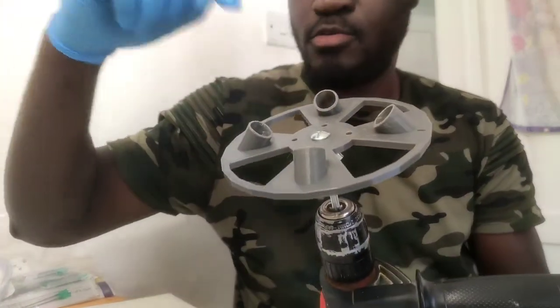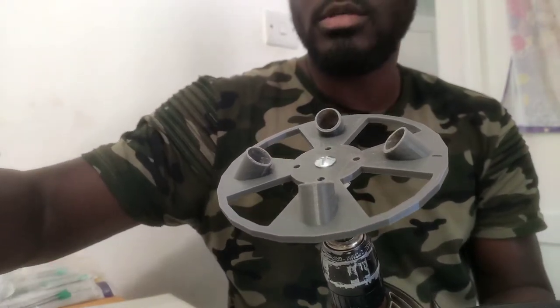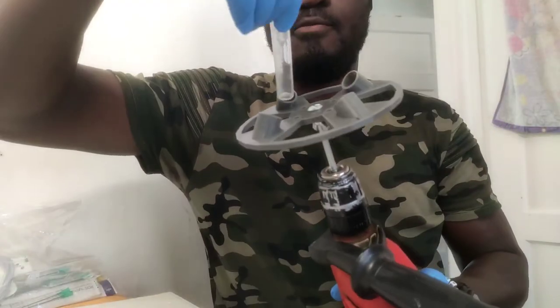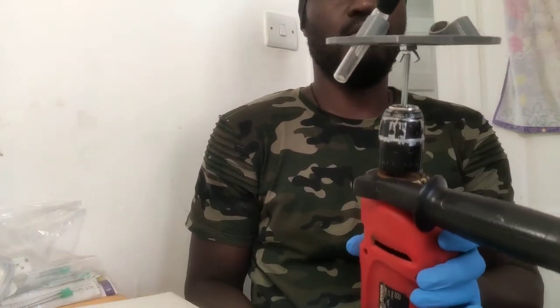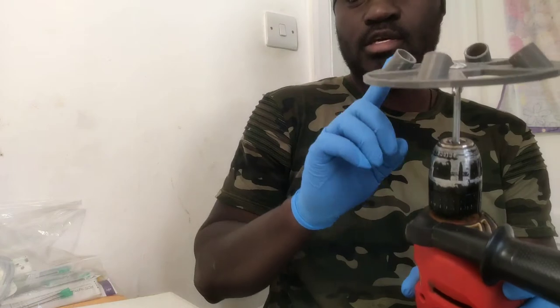I have a centrifuge. That's gonna have all this in. Hang on a second — gonna have this in. Right, and then I can spin. That's the idea behind all of this.